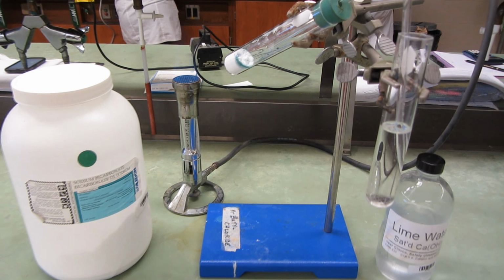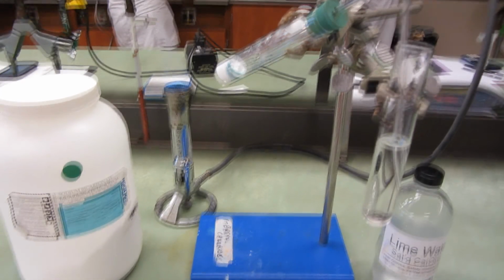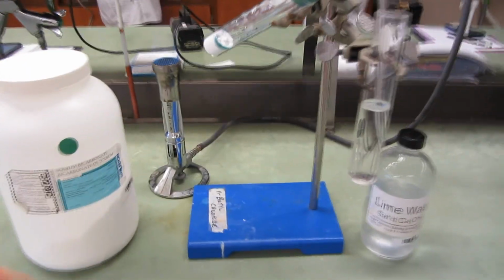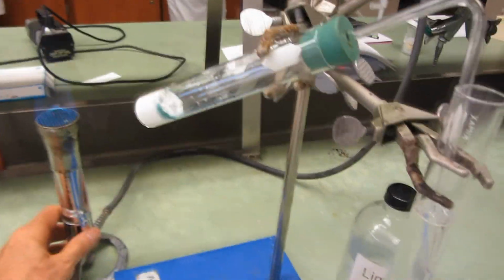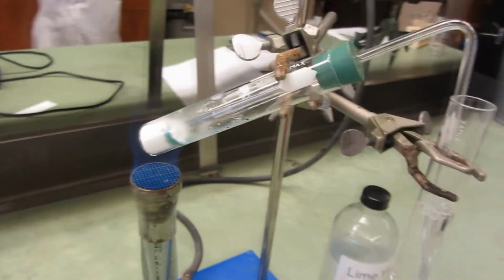In the vertically mounted test tube, I have a clear, colorless solution of calcium hydroxide called lime water. In the test tube that's mounted on an angle, I have a white, solid sodium bicarbonate. You'll notice also it's got a blue-green hint to it. That's a couple drops of universal indicator I've put in, and that indicates that sodium bicarbonate is in fact a weak base. When I start to heat this, the carbon dioxide gas will be liberated and react with the calcium hydroxide in the test tube that it's bubbling into.